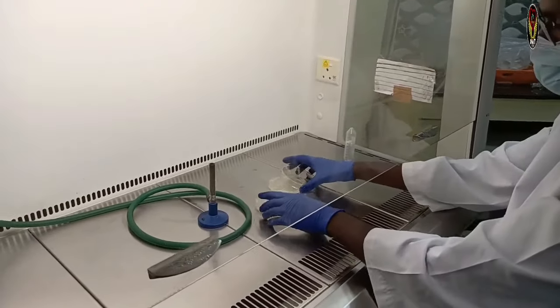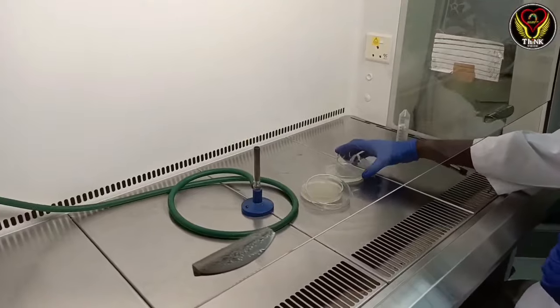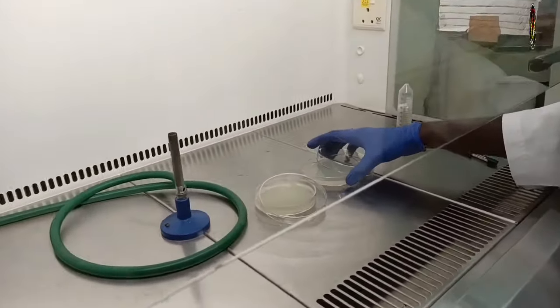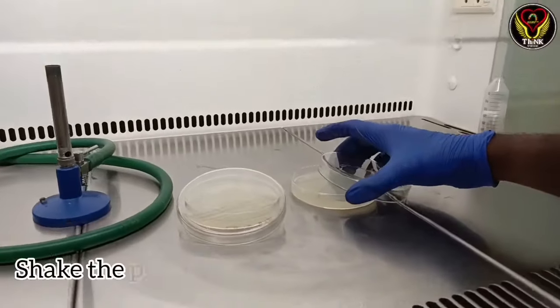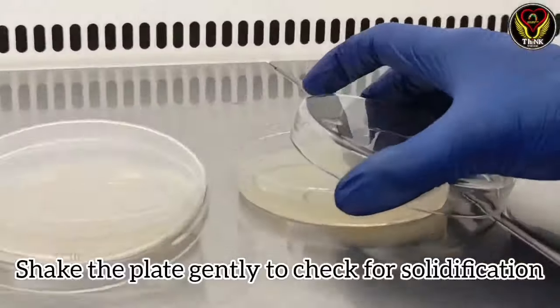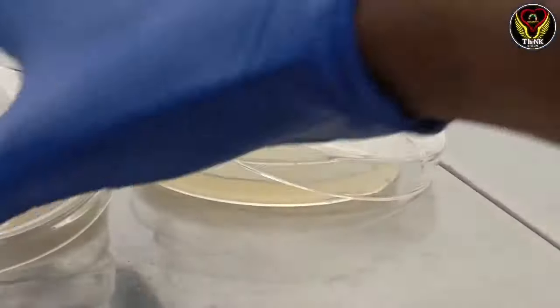Let's check if the media has solidified. Let's see if we shake the plate with the agar. Let's check if the plate is solid.